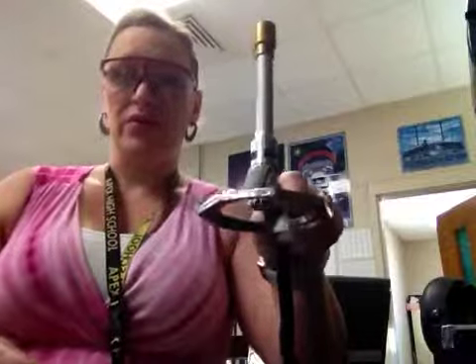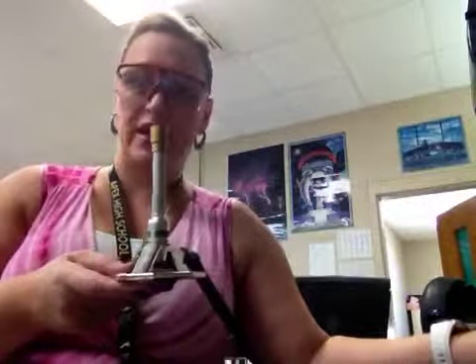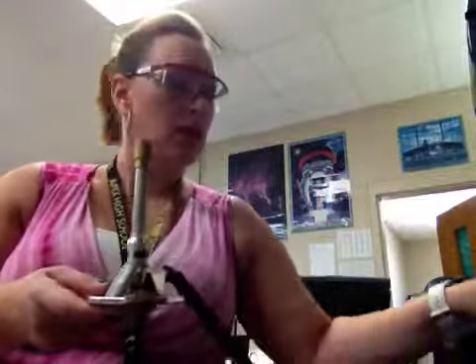So for starters, please make sure you're wearing your safety equipment — your goggles, your hair is pulled back — and I'm going to show you how to light the Bunsen burner. This is a Bunsen burner, and it's plugged into one of the gas outlets.